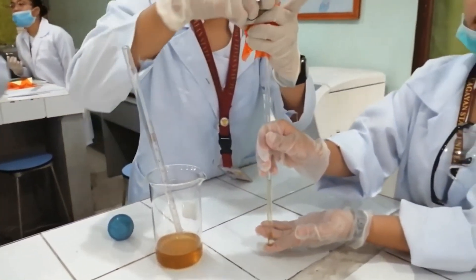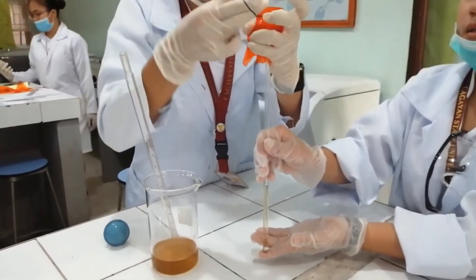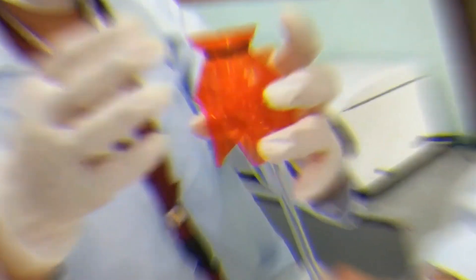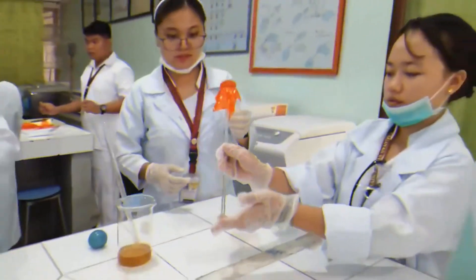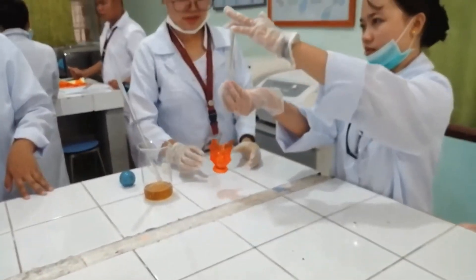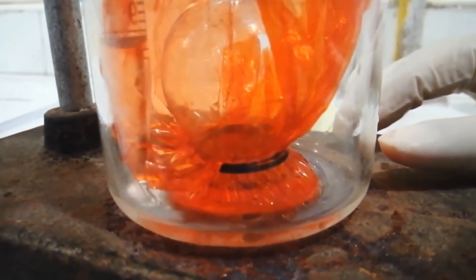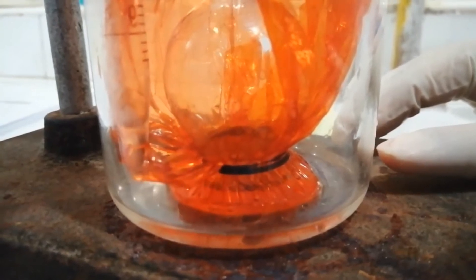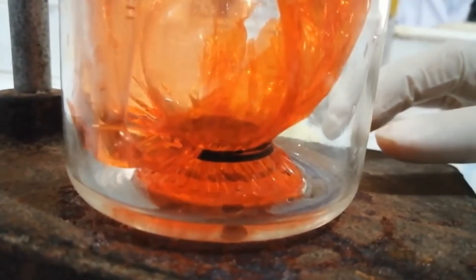Next, cover the large end of the thistle tube with cellophane and tie it using a rubber band. Turn the thistle tube upside down and suspend it in a 500 ml beaker with distilled water. See to it that the level of the sugar solution coincides with that of the water outside the thistle tube.